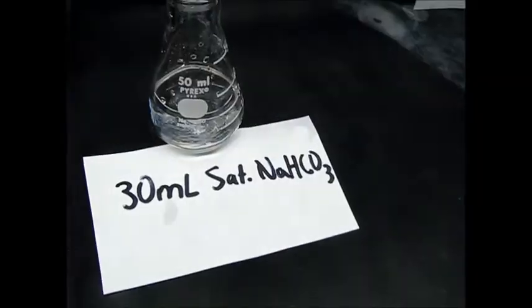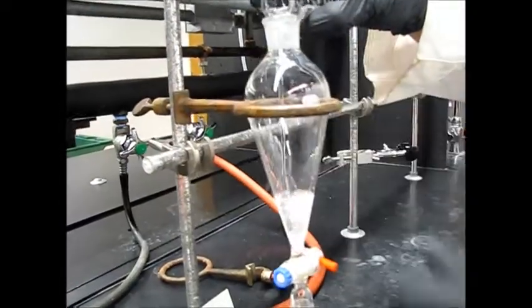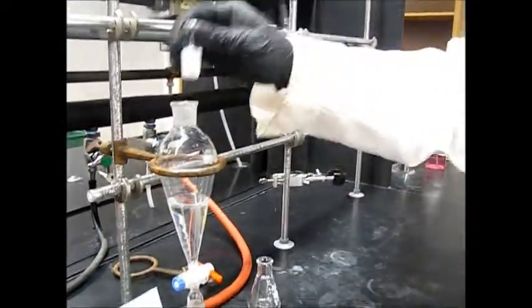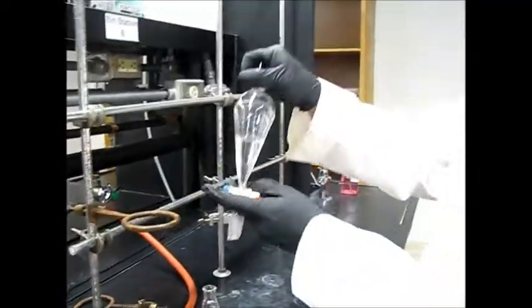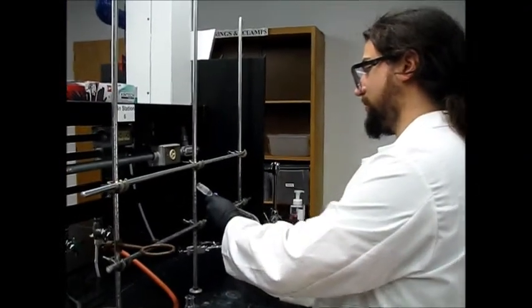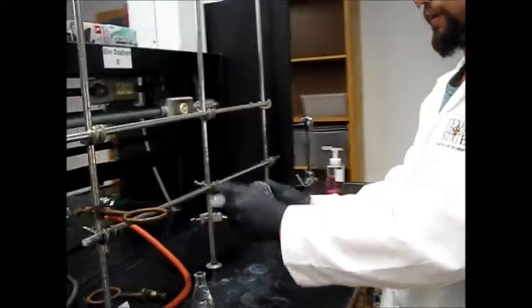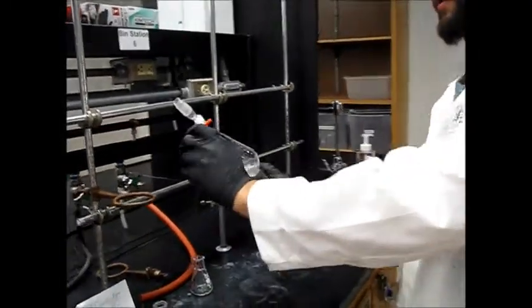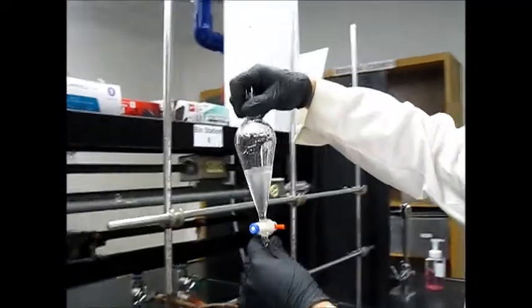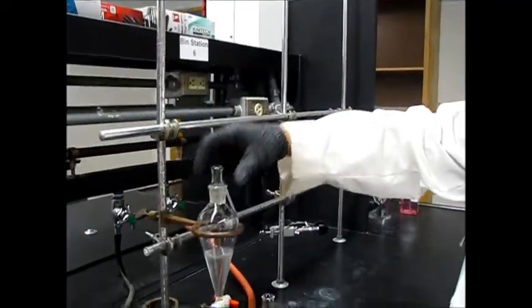Now add in your saturated sodium bicarbonate solution — you'll notice some light bubbling. Place the stopper on, hold it from the top and bottom, shake, and remember to release pressure upwards. Wait a moment, then turn and shake again, keeping it pointed up. You will again see the organic layer on top and the sodium bicarbonate layer at the bottom. Let it sit for a minute to allow better separation.